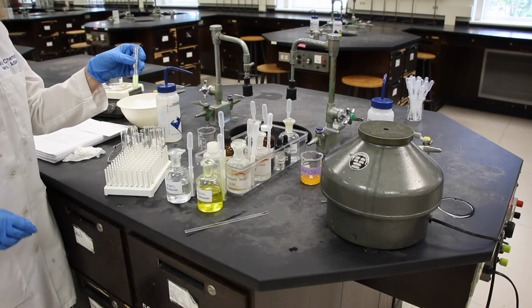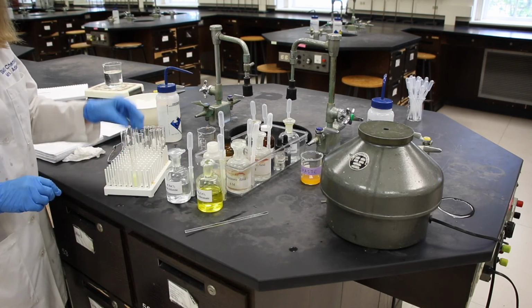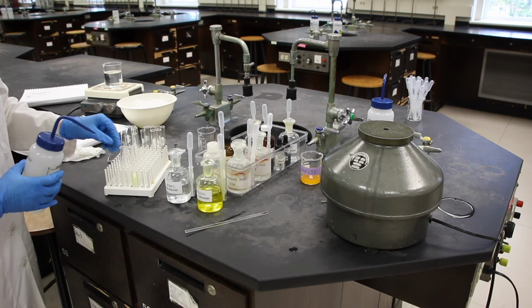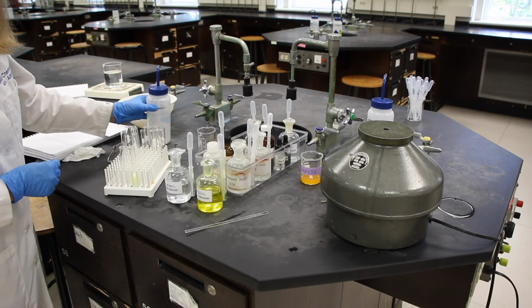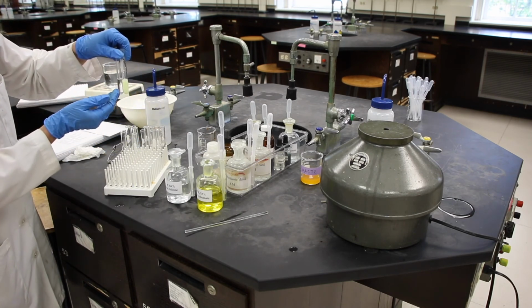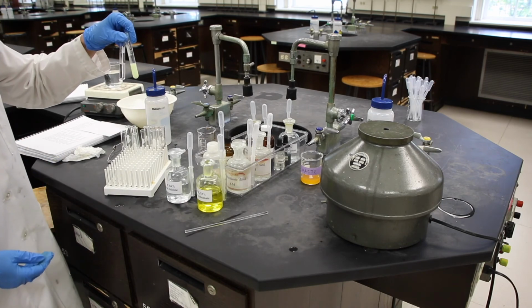And we're going to need to centrifuge it because we only want to deal with that precipitate right now. And we're going to use a centrifuge, but the first thing I need to do, our centrifuge has to be balanced. It's kind of an older model, maybe even before I was born. We need to put something about an equal amount of water in a test tube in one of the opposite holes of the centrifuge so that it is balanced.